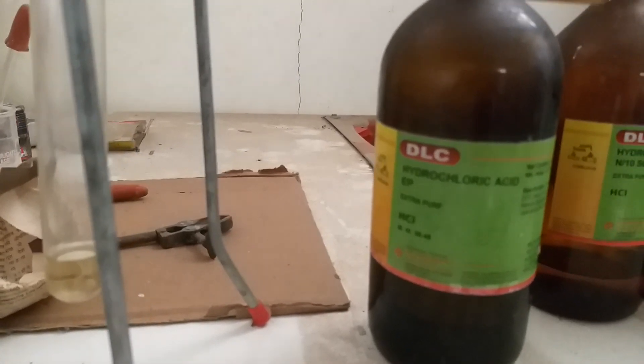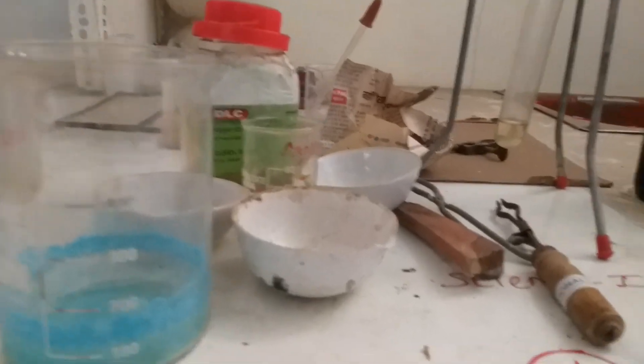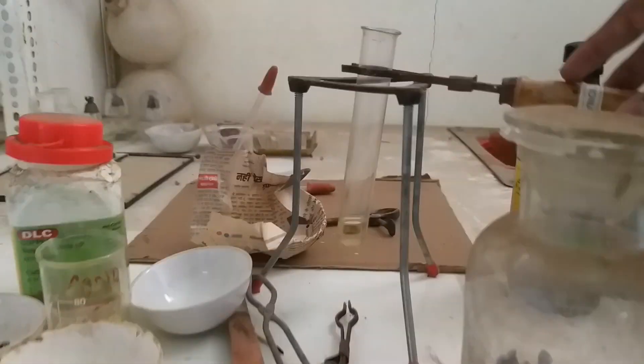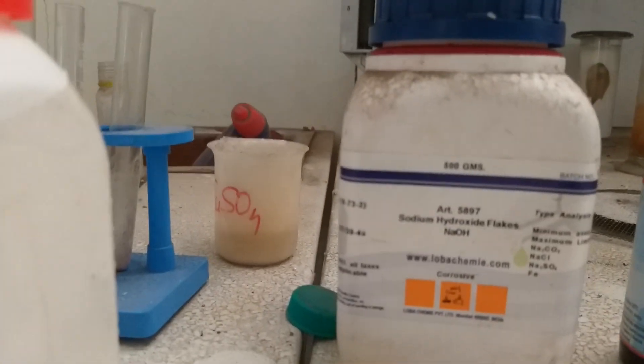This is extra pure concentrated hydrochloric acid for various reactions. We can carry out the reaction of zinc and hydrochloric acid and find out how hydrogen gas is produced. These are the test tubes placed in the test tube stand.